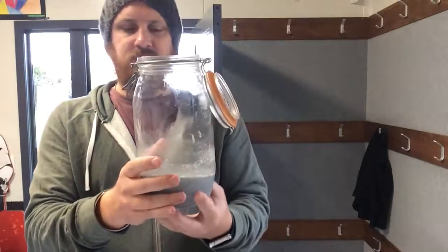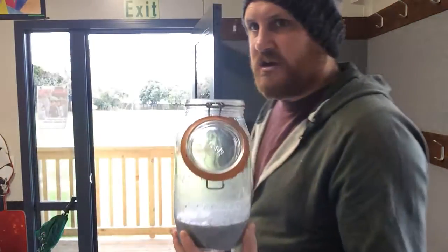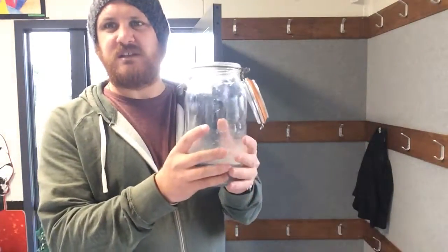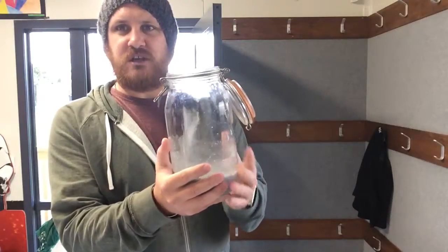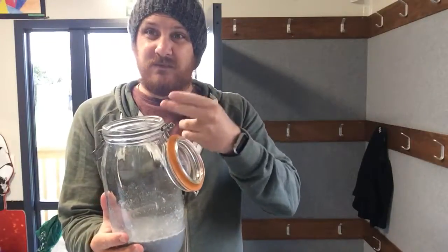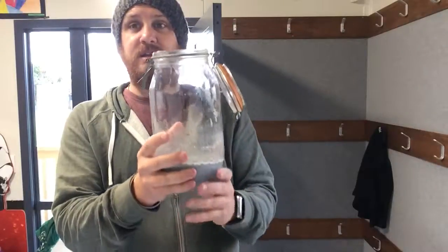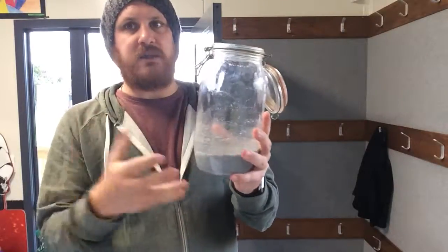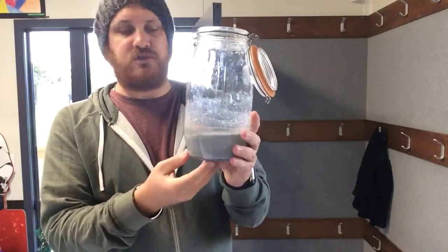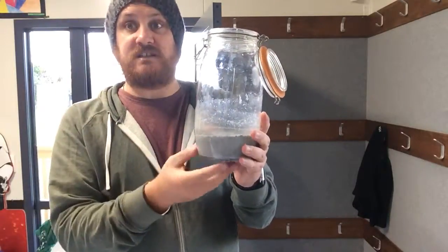So it's a bit of a shame, and no steam was produced this time, and I wonder if it's the days, like you can kind of see out there, it's quite overcast outside, it's quite cold, we're really into winter now, and it wasn't able to produce as much heat. Now if I redid this experiment, chopped up the aluminium shavings even finer and added a bit of hot water to really dissolve my powder properly, I think it would probably go for it. But so you can actually see the steam being produced, I'll edit in some of the footage I took yesterday where we could actually see steam.